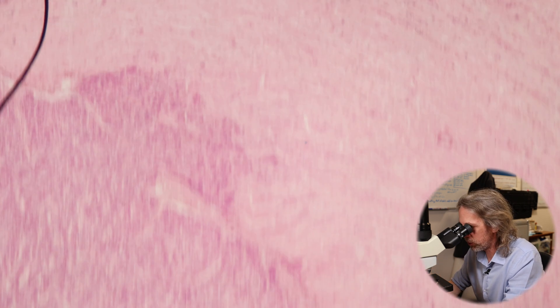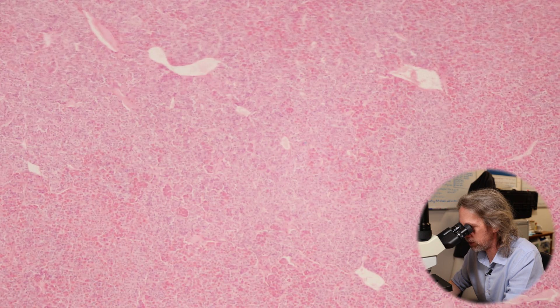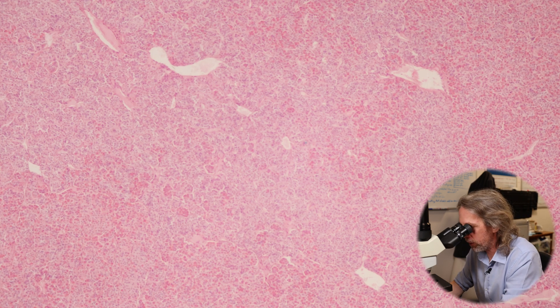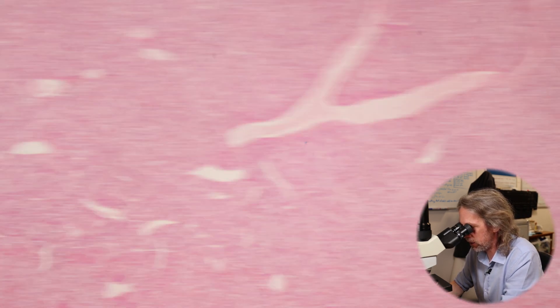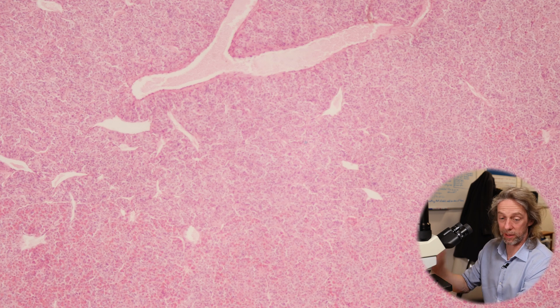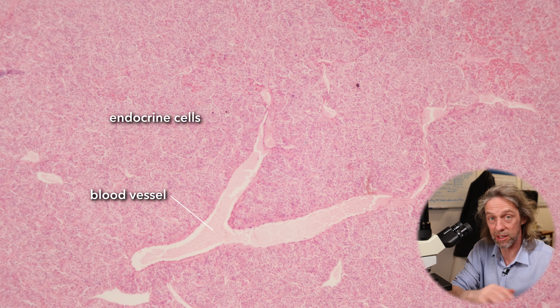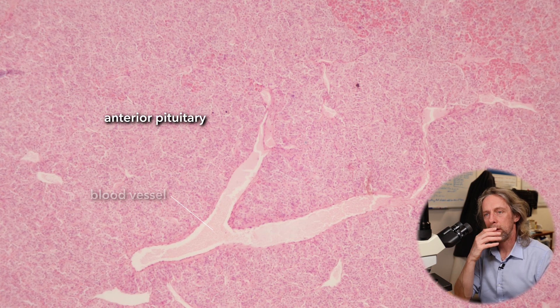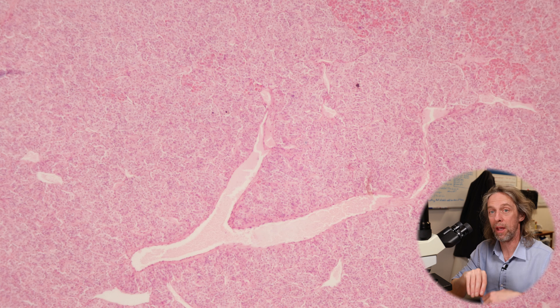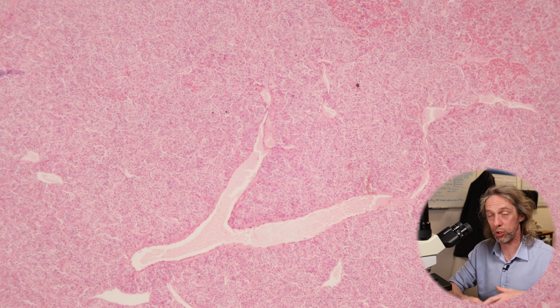The pituitary gland is an endocrine organ, meaning it secretes hormones. Hormones go into the blood, travel around the body, and have an effect on tissues and cells at a distance that have a receptor for that hormone. Here's the anterior pituitary — it looks very glandular. The spaces we can see are blood vessels, so there are lots of capillaries because the hormones need to be released into the blood. Also, the pituitary is controlled by the hypothalamus, which sends hormones to the pituitary triggering it to release hormones to other organs.